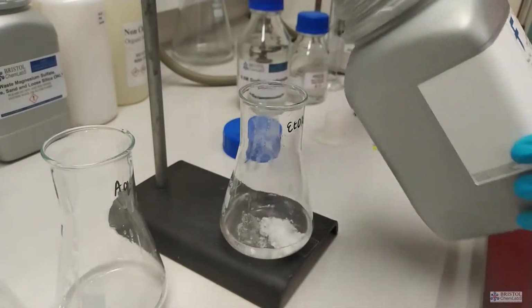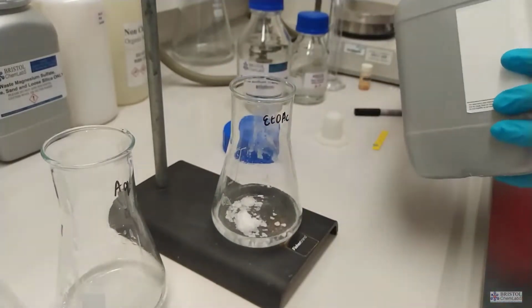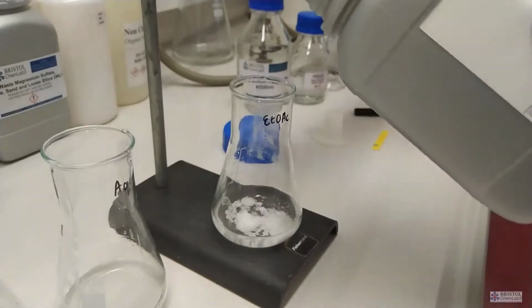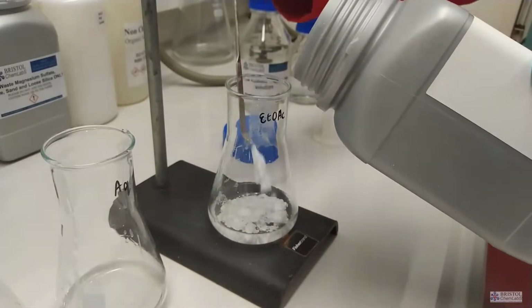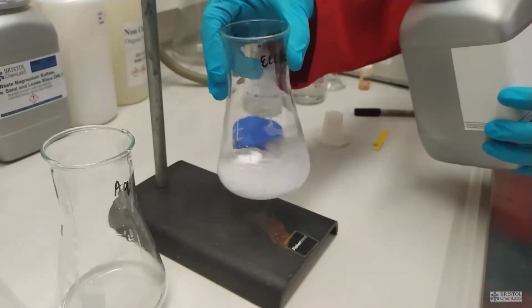Chemical drying agents are typically calcium or magnesium chloride or sulfate, but all are anhydrous. In other words, they have no water of crystallization. Here we're using magnesium sulfate. Magnesium sulfate can put around itself 7 molecules of water of crystallization, so it's good at removing water.